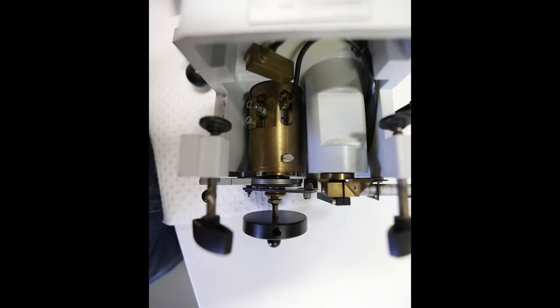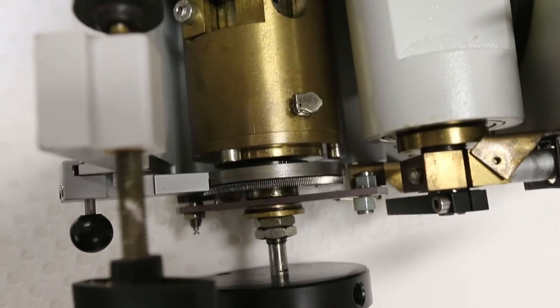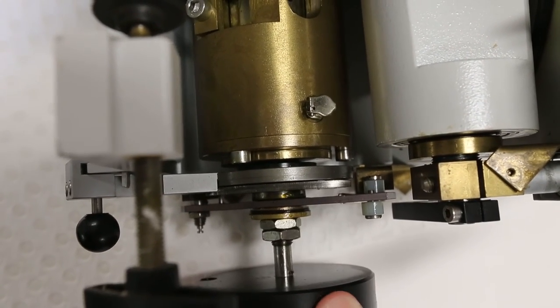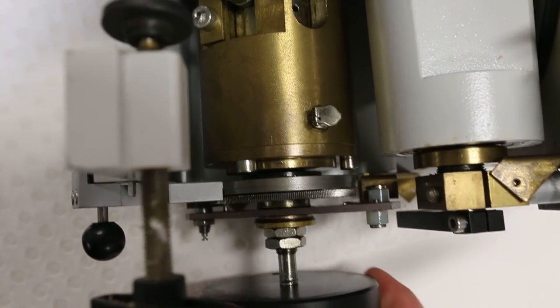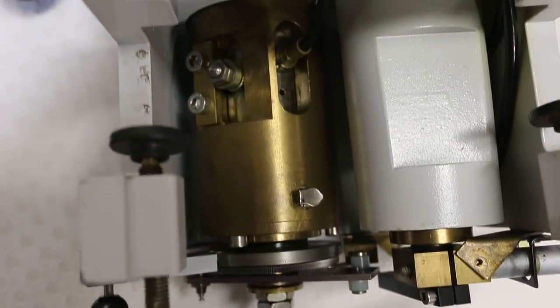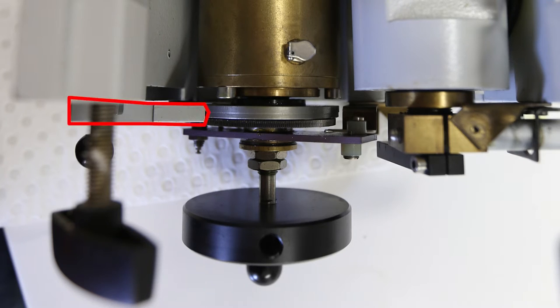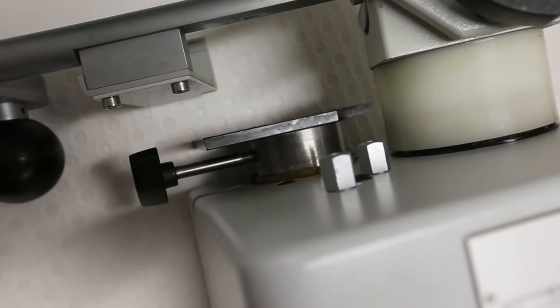Now, I took the cover off the front, so I haven't taken anything else apart, but I took the cover off the front just to see if there's anything obvious on the inside that was going wrong. But as near as I could tell, everything was fine. So when you twist the adjustment lever on the bottom, the various cogs that I could see on the outside of the machine were all working. These nuts here were both tight, and so therefore the adjustment dial seemed to be attached to the spindle correctly. As I say, the blade arm mechanism was touching and operating against the ratchet correctly, as near as I could tell. But just the stage fails to either go up or down now.